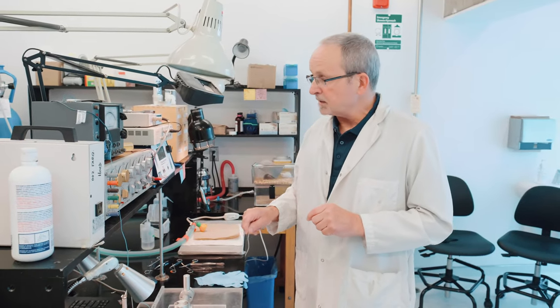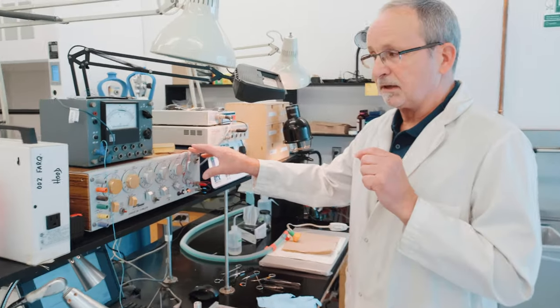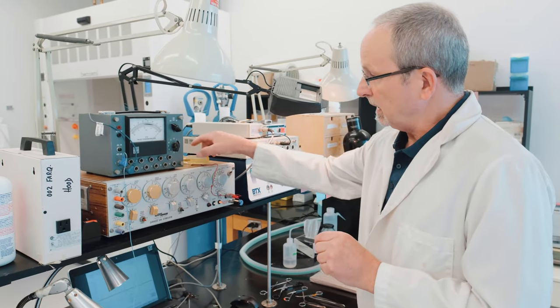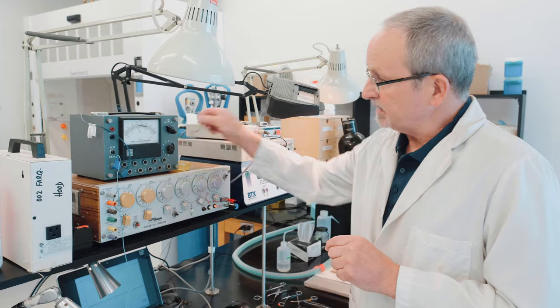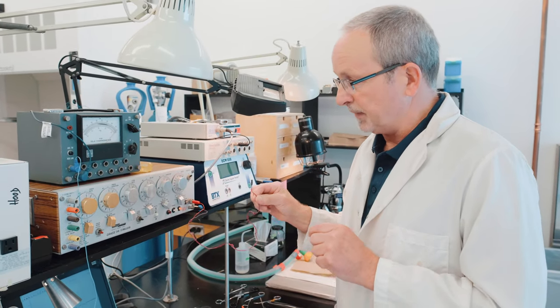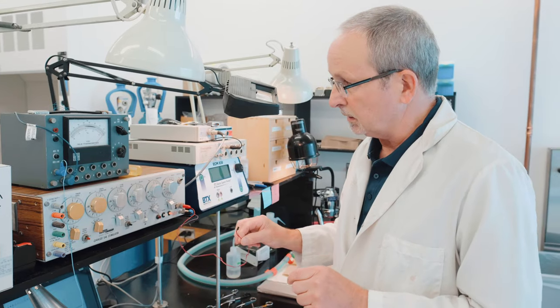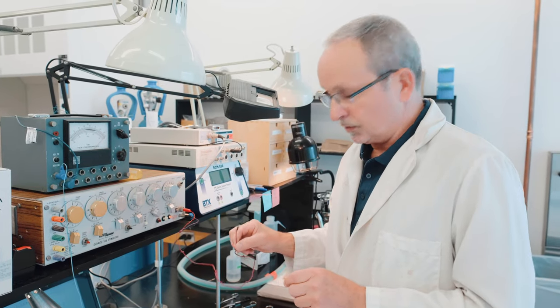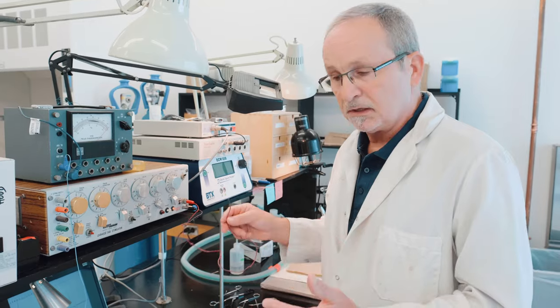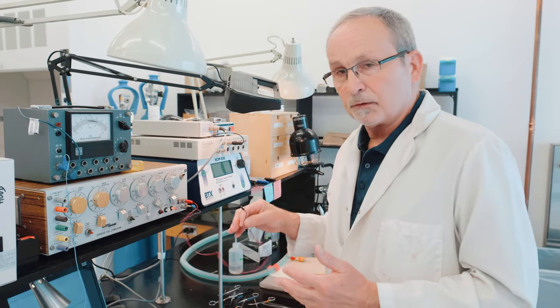To make the muscle contract, we have a stimulator that varies the workload to the muscle. I have an electrode that I'll attach to the sciatic nerve of the animal that leads to the hind limb muscle, and that will make the muscle contract. I can make it contract at various intensities and frequencies to elicit different workloads.